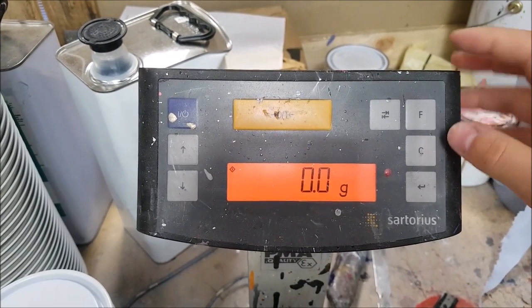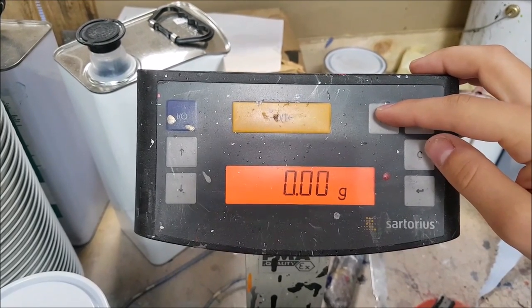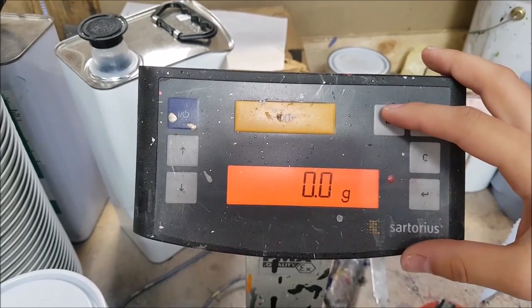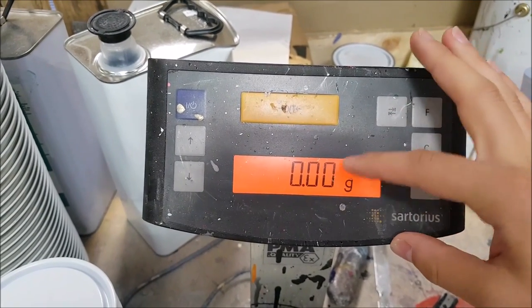The toggle being on now allows the toggle button to be used, which switches between the two modes. It still might not work yet, so we're going to set it to where we can apply this setting to the toggle.